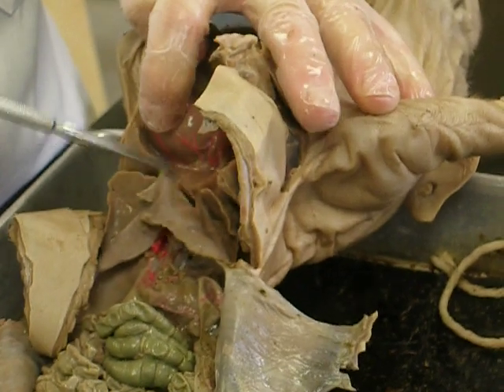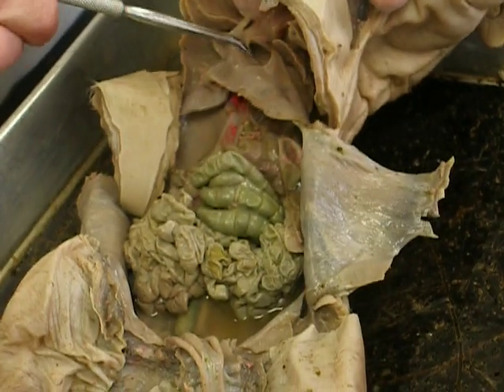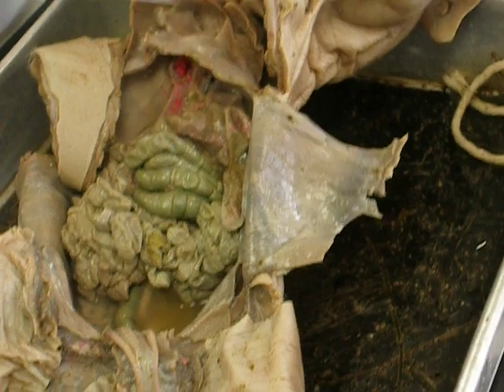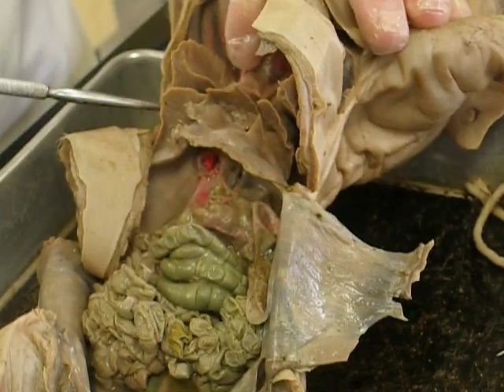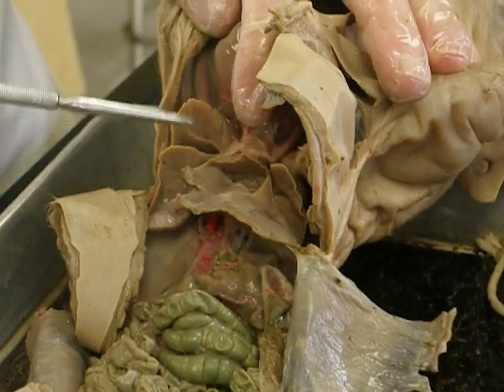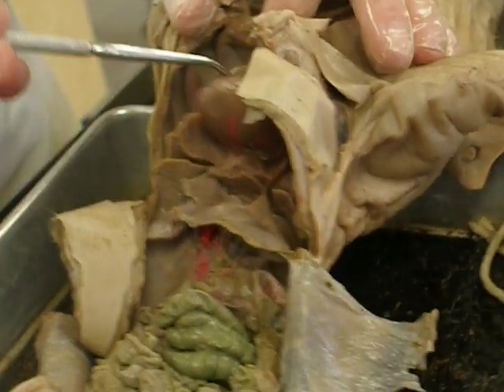three lobes. In the middle, there's an intermediate lobe. There's three on each side, and then this one in the middle — intermediate.